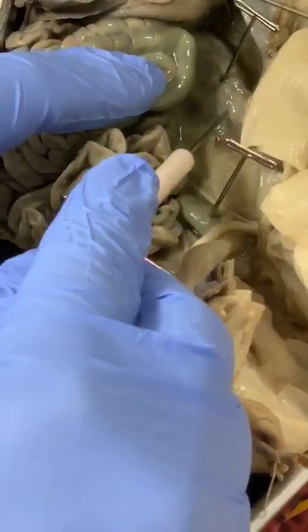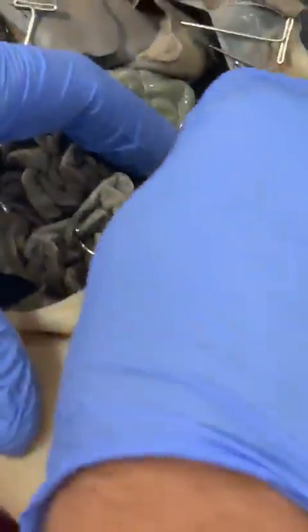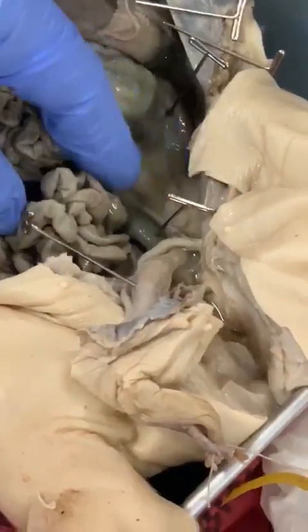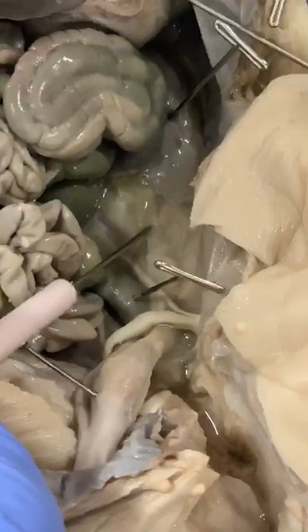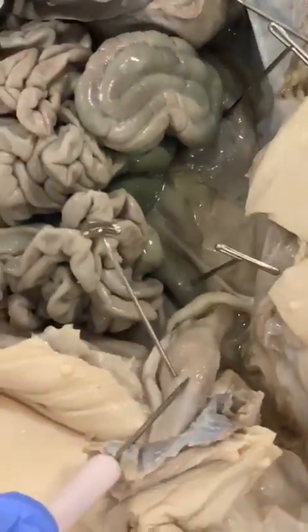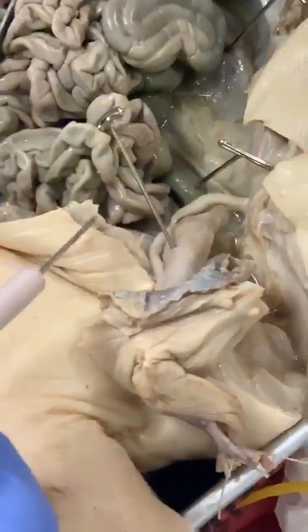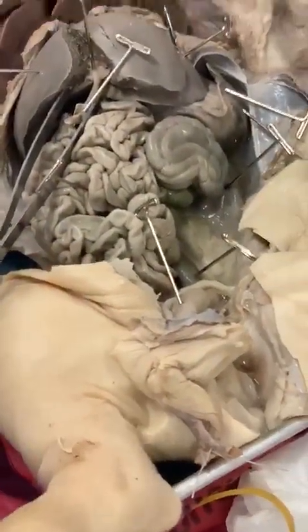the kidney. So it's going to be your left kidney, and the ureters are right there. Both ureters go all the way to the urinary bladder and then go out of the urethra on the outside. So this is the urinary bladder. So far so good? I guess I'll pause it, guys.